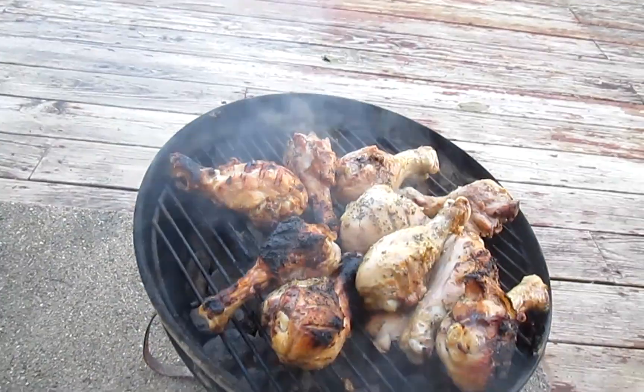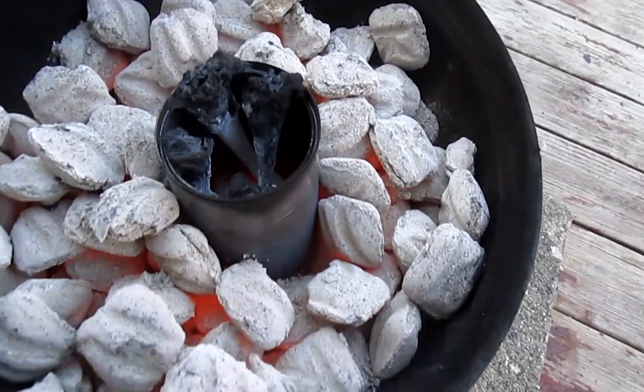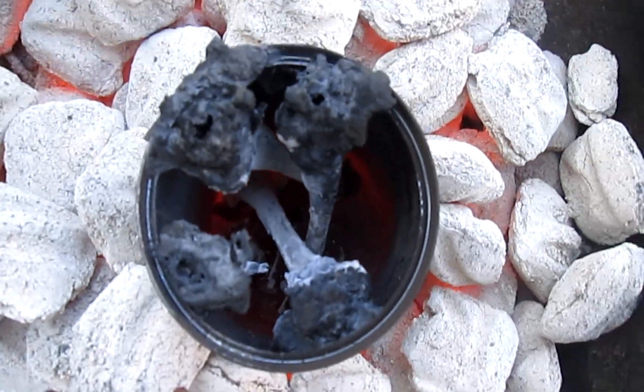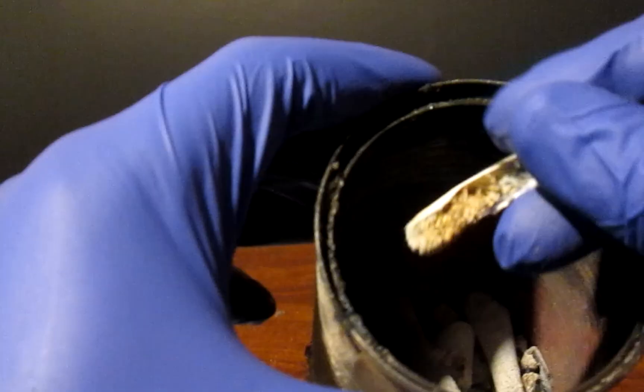Seasoning, cooking, eating. Once again sacrificing my body for science — it's a difficult job, but someone has to do it. The leftover bones are then heated at about a thousand degrees in air to eliminate all organic product and oxidize most metals.